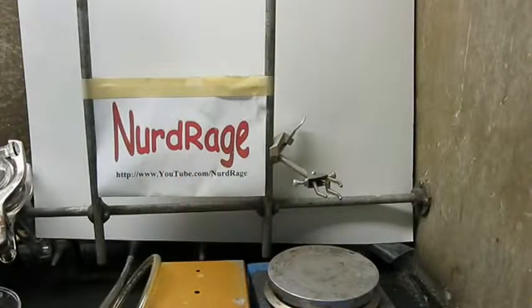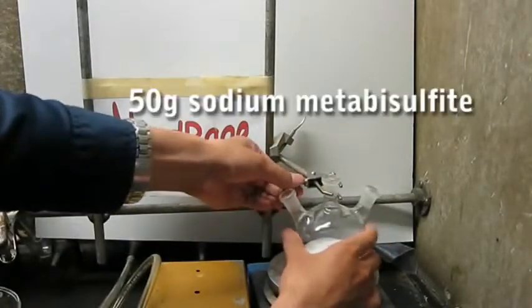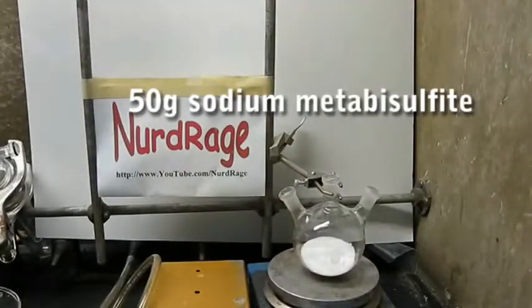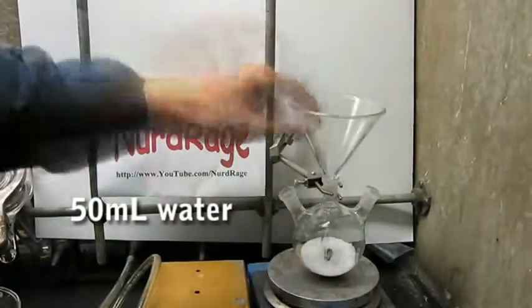First, we need to make a sulfur dioxide generator. In this case, get a 3-necked flask and fill it with 50 grams of sodium metabisulfite. Then, add in a stir bar and 50 milliliters of water.